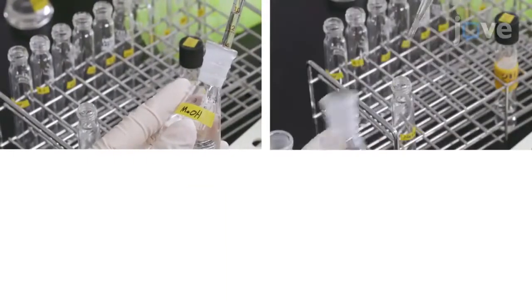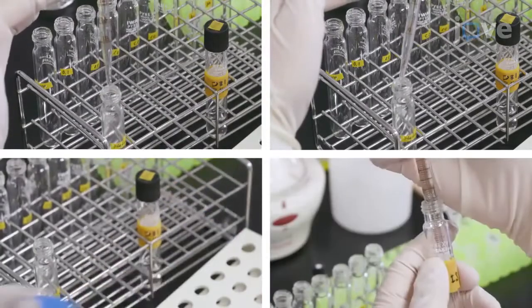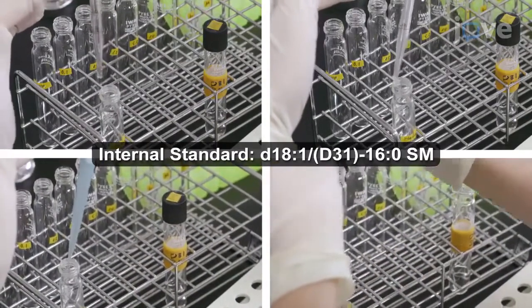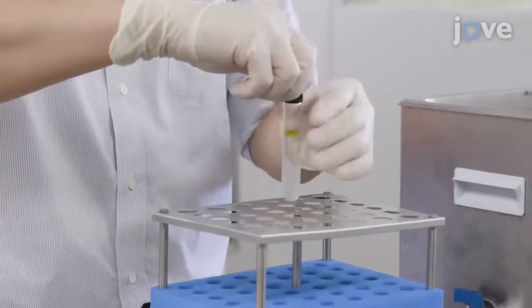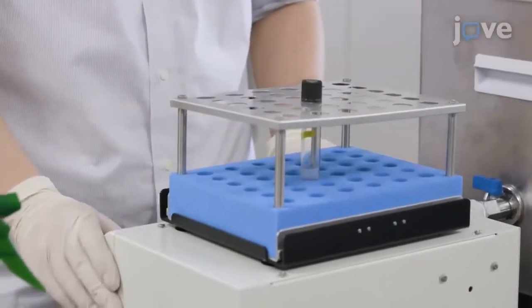Now, add 1 ml of methanol, 1 ml of chloroform, 0.8 ml of double distilled water, and 50 microliters of 10 micromolar of an internal standard into each test tube. Cap the tubes and vortex them vigorously at 2,500 RPM for 5 minutes at room temperature.